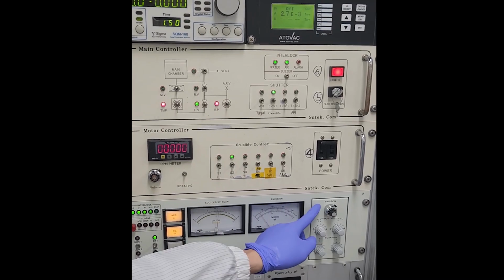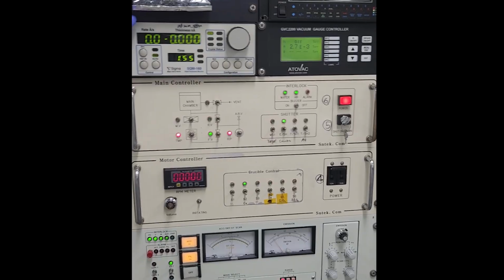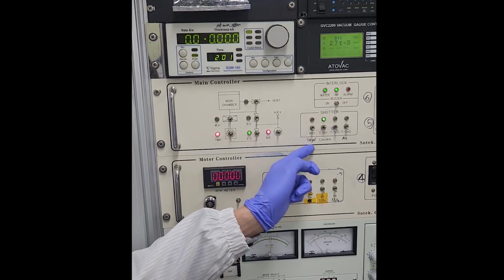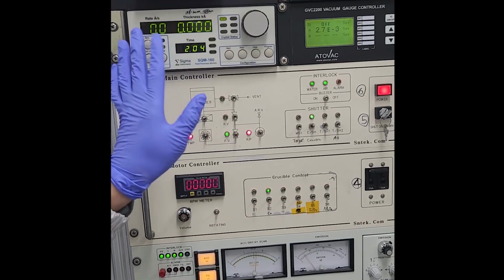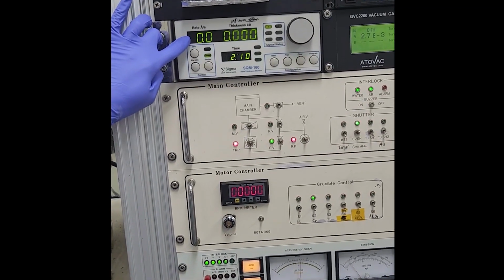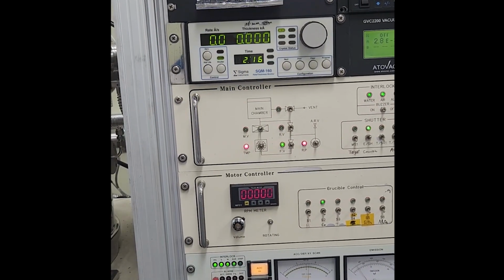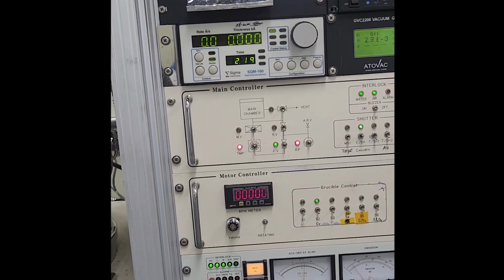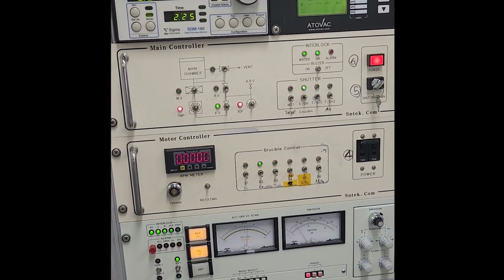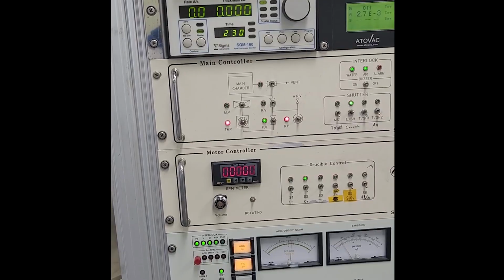When you increase the emission, you should wait until the rate is stable, and then open the target. Don't open the target first and then increase, or the thickness will not be right. You can see the rate is slowly increasing, right? Now 0 goes to 0.1. We increase a little bit like that to make sure the rate is stable.